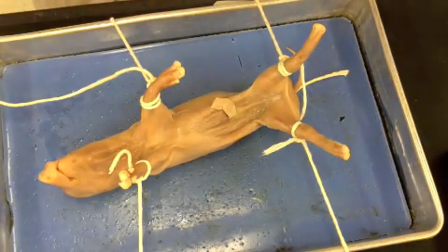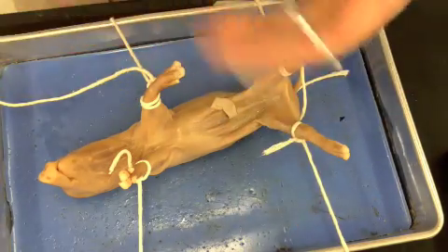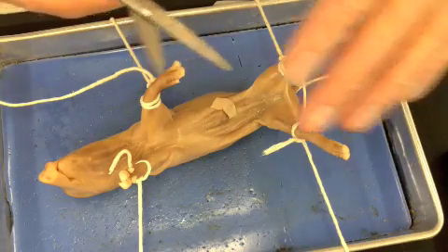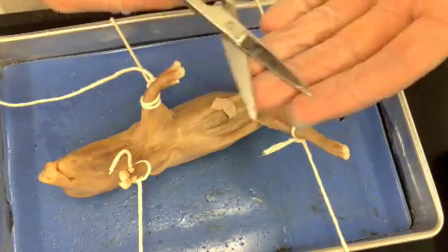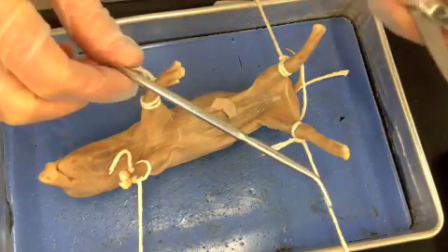Now we're going to go to the inside, and we're always going to start with scissors. When you're doing dissection and using scissors, it's probably one of your best tools to use. This and a probe I find to be just fantastic tools to use.